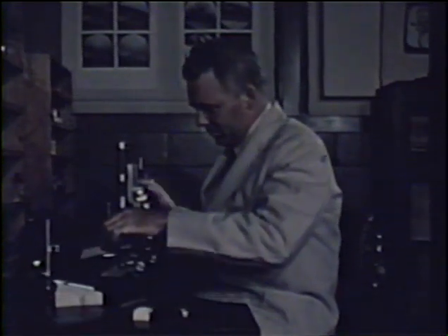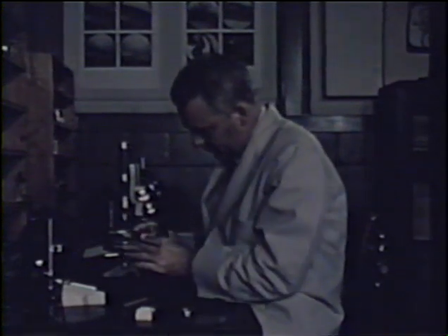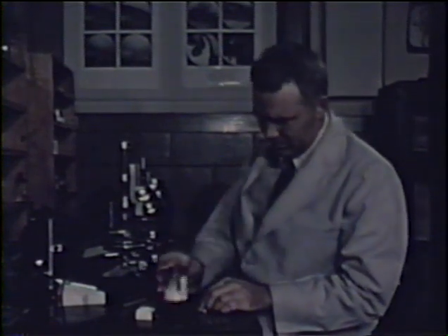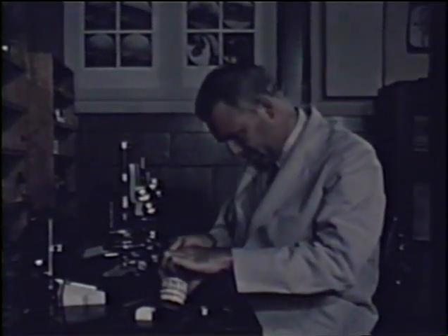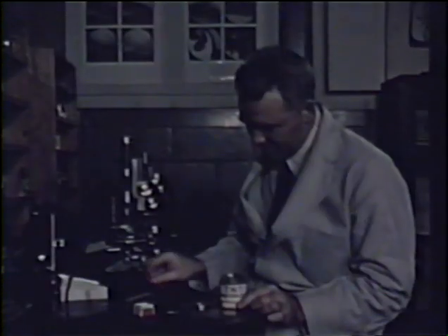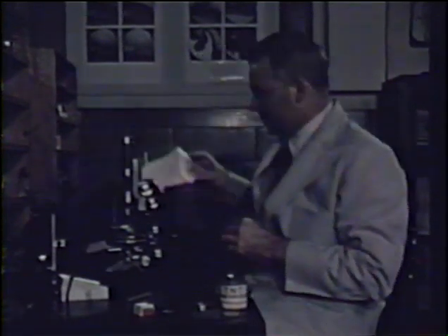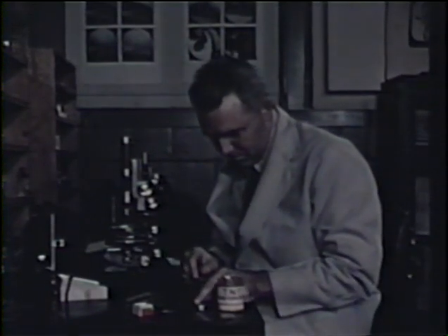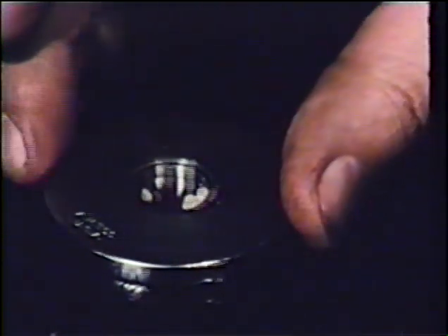Sublimation is also useful as a method of purification, and the next demonstration shows a technique which can be adapted to the preparation of several hundred milligrams of pure material or to the formation of large single crystals, such as might be required for optical crystallography, goniometry, or X-ray diffraction. A small quantity of the compound to be sublimed is placed in the sublimation block. A clean cover glass is then placed over the opening in the block, and then the block is placed on the hot stage.